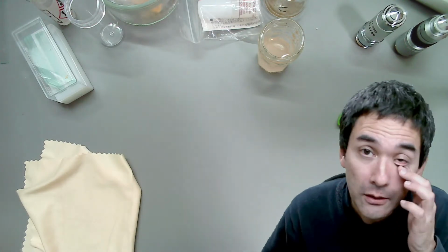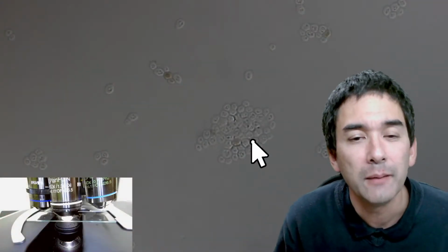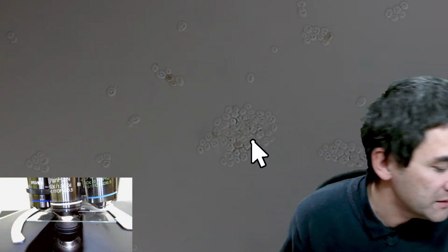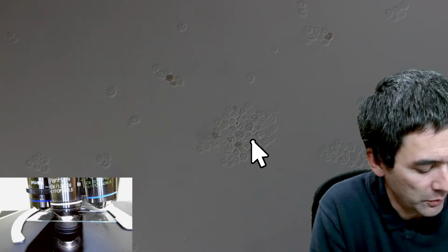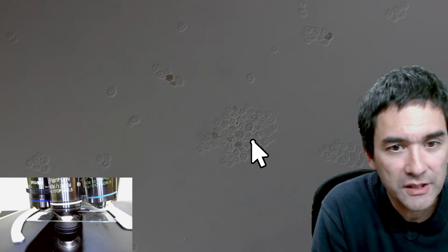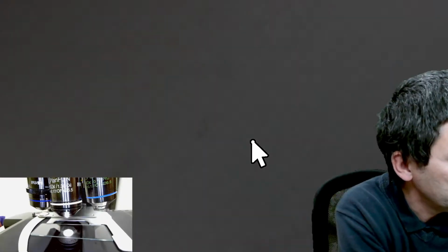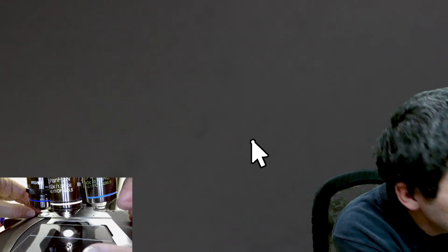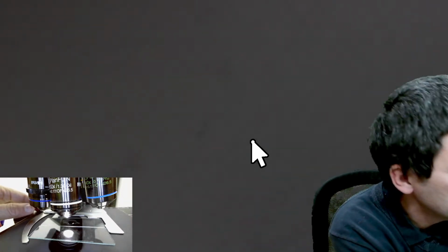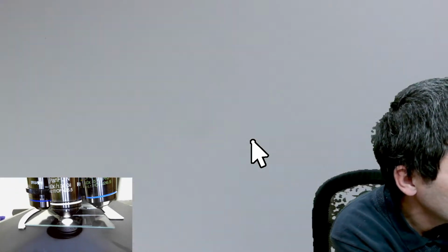Basically, yeasts are so-called eukaryotes. Actually, let me go back here to show you. Honestly, I don't like this specimen so much. Let me go back to the other one, the one where I had it in water. Just a second. Let me lower this again and put in the other one. I'm going to put it in simply here next to it. My slide holder is able to accept multiple slides. And let's go up again, hoping that there's still enough oil in here.